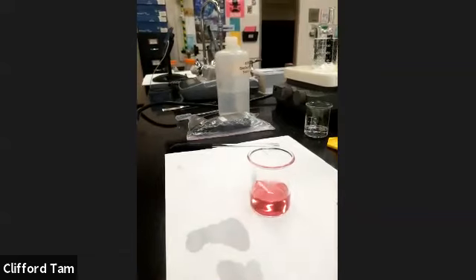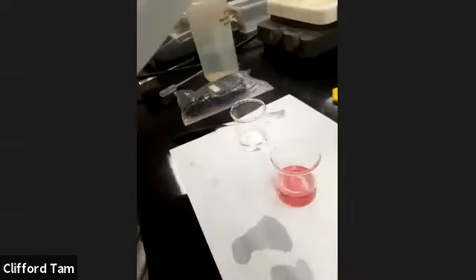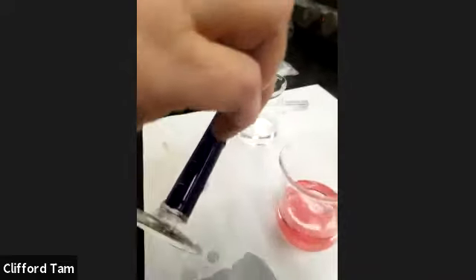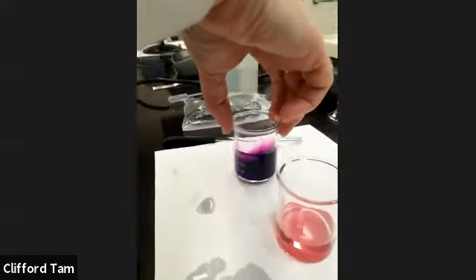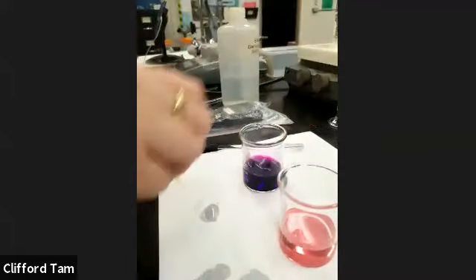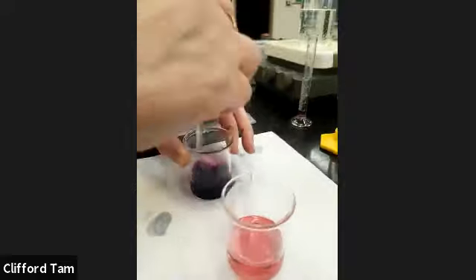So this is at around 3 minutes and 30 seconds. Perfect. We'll let it keep going on its own, and now we're going to do the other one. This is around 3:30. She's pouring it in. We'll see how much time it takes. The beautiful purple color yet again. And she's now going to use a stirring rod to try to increase the number of effective collisions between the two.